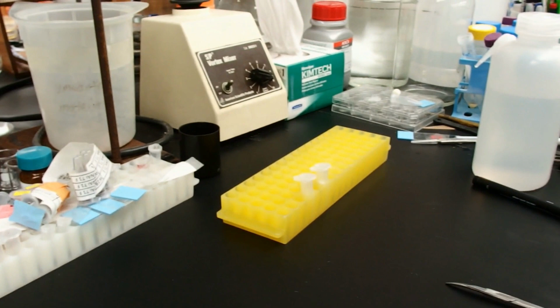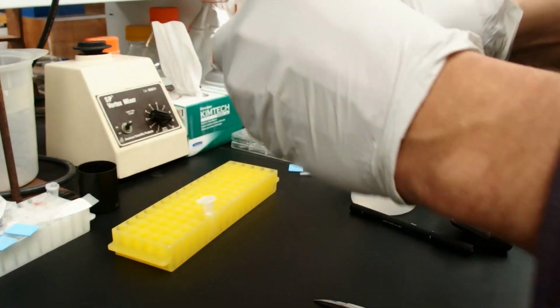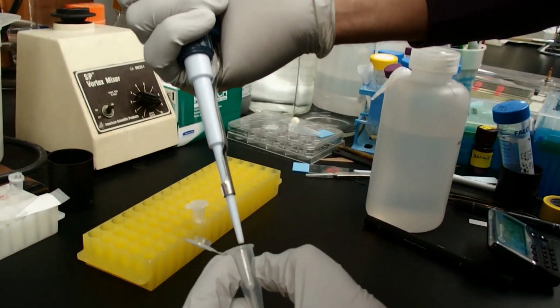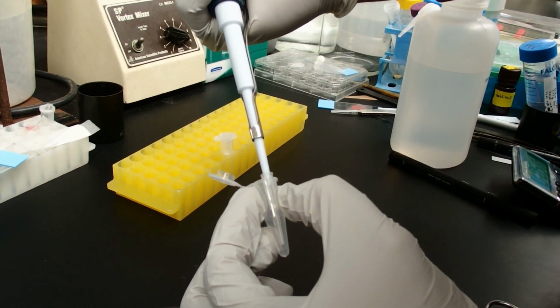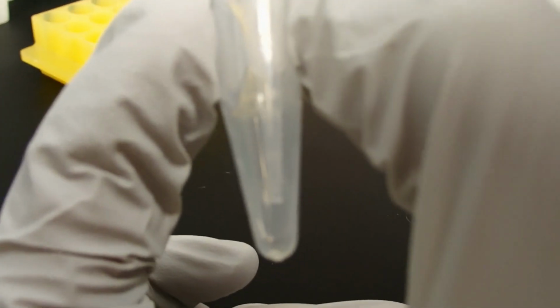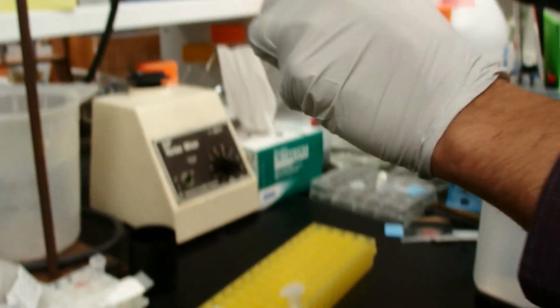To get these out, we'll use a pipetter. For the 10 microliter pipette tip, we'll use the P20. We'll just put it in here, gently. And if you have anything left over, you see actually there is no droplet inside of the tip. All of the liquid is left behind. Look at that.